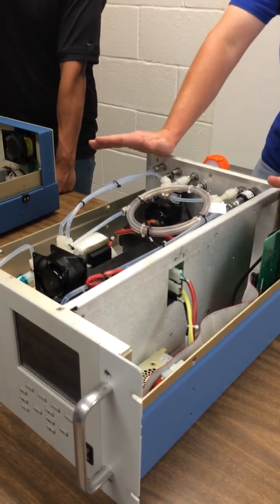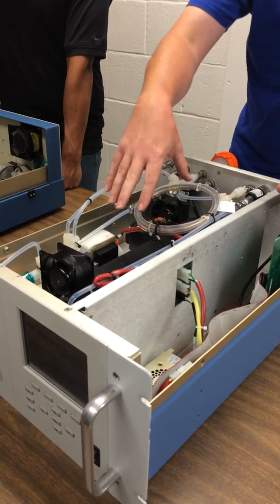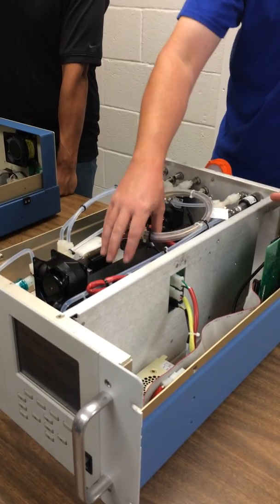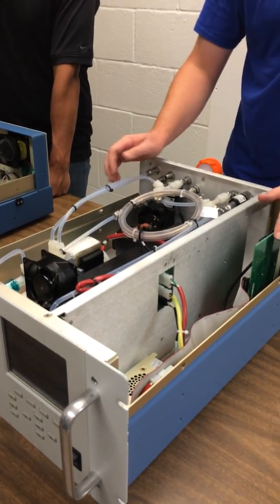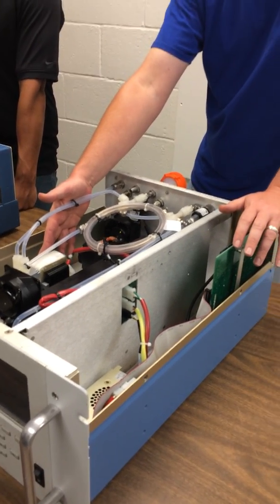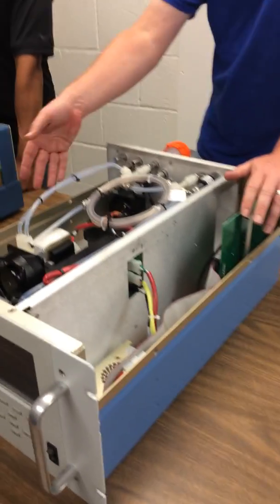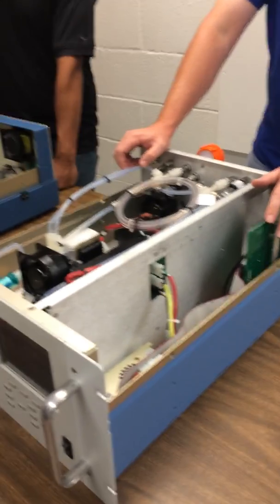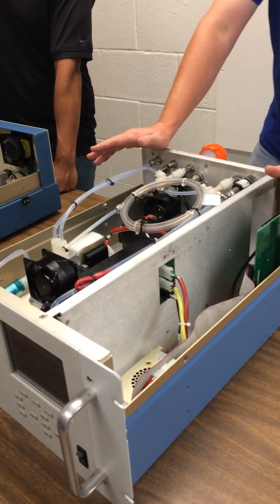In general, they're all fairly similar. You have an inlet, you have your measurement bench and your detector. You have your sensors to help you do your diagnostics, whether it's pressure, flows, and temperatures. You have a pump to move it through. The pump, and just about everything we do, we put the pump at the very end. That way we haven't affected the sample as it comes in.